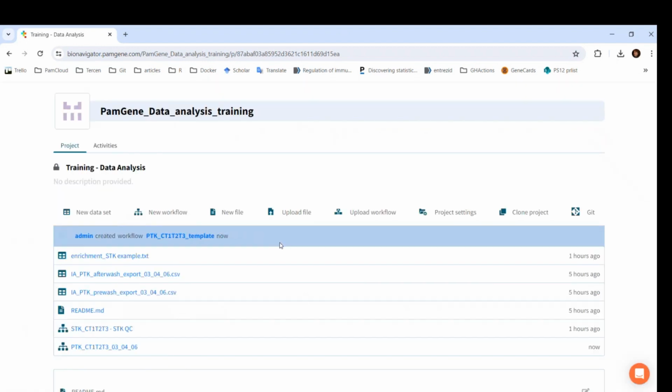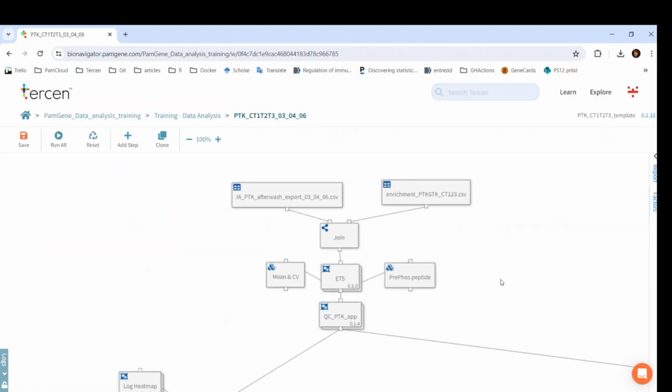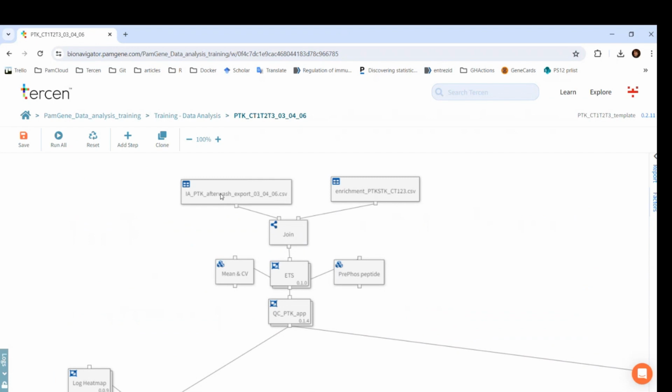Let's take a quick overview of the beginning of this template. It starts with uploading and joining two data tables. One is the export from the image analysis, and one is a data table called enrichment. This is an annotation file for the samples. Next, there is a step called ETS, which is the exposure time scaling. It combines median signal minus background values at multiple exposure times to create a single value per cycle, which is the S100.